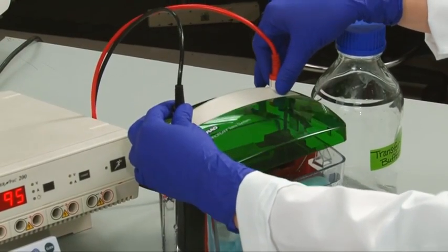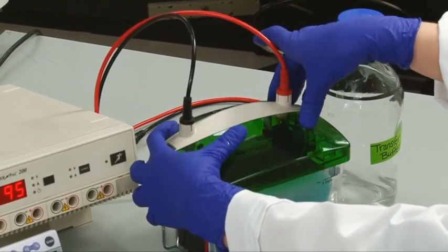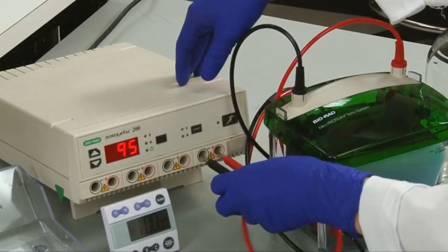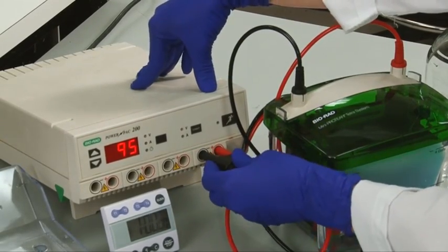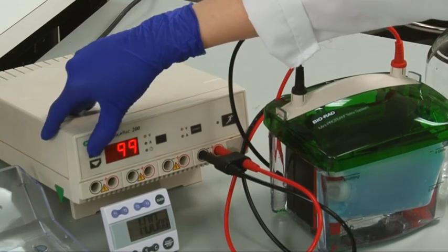Close the chamber and connect to a power supply. Perform the transfer according to the manufacturer's instructions, which is normally 100 volts for 30 to 120 minutes.